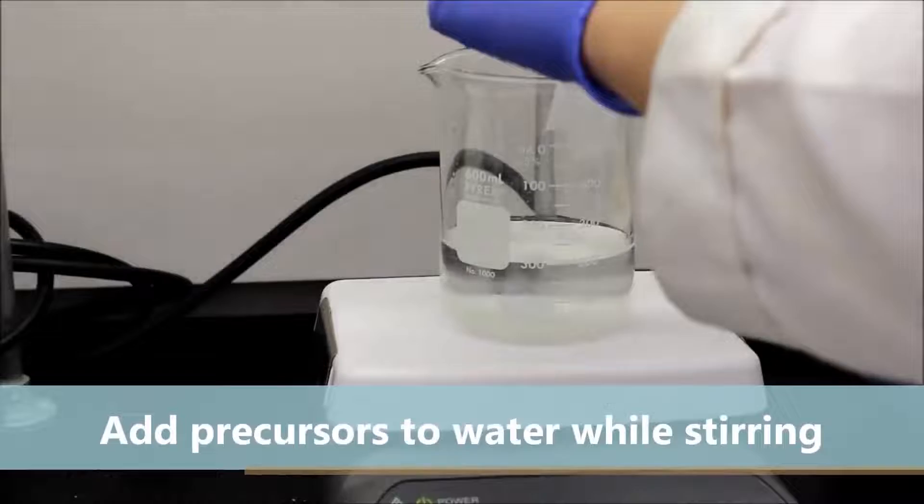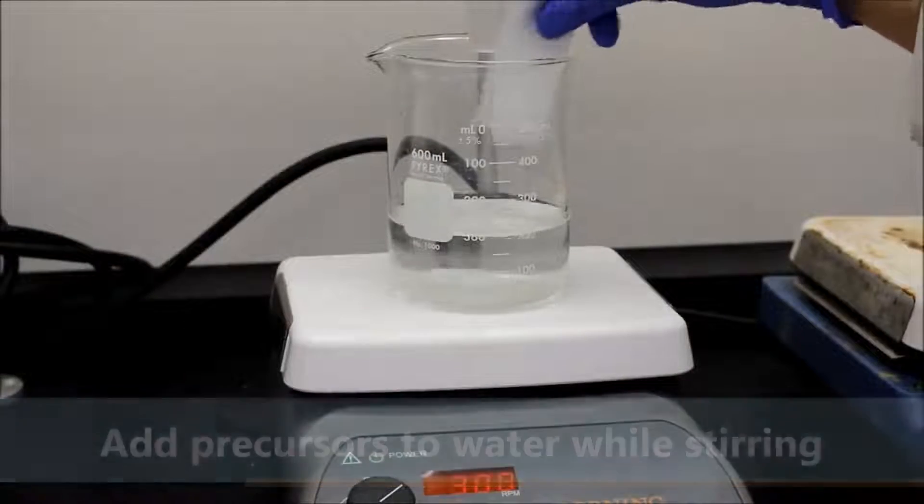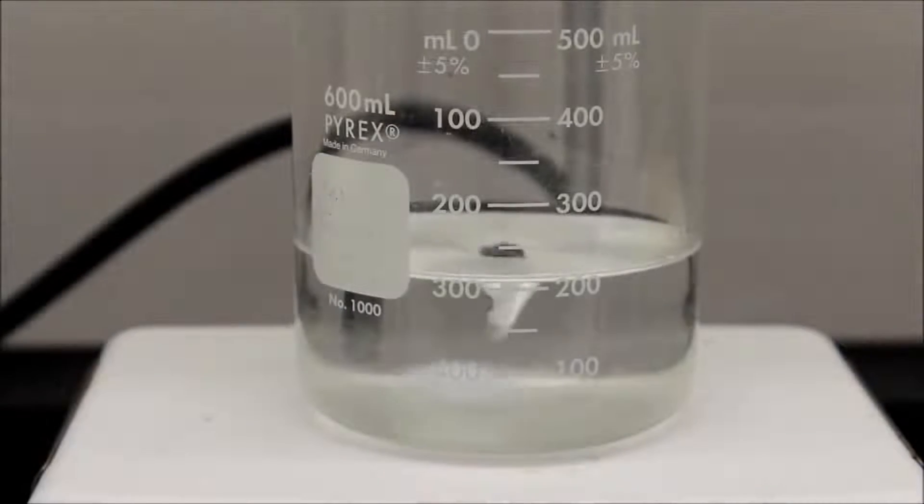Next, add all materials while stirring and allow the starting material to dissolve simultaneously.